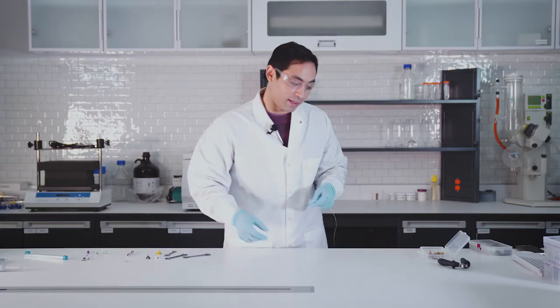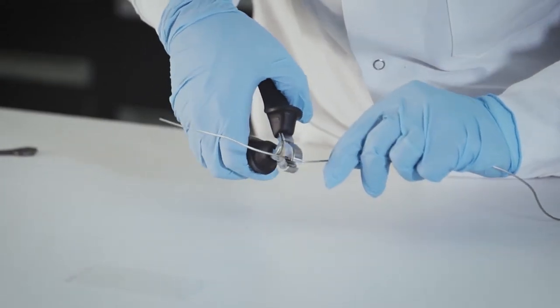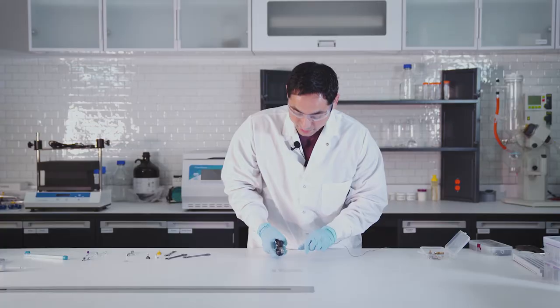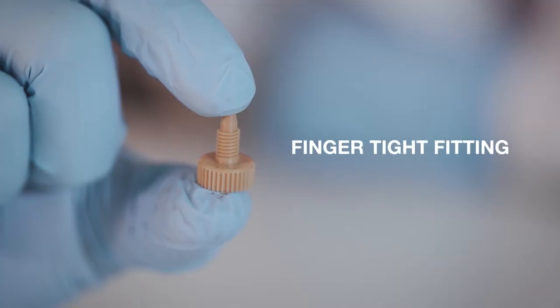Instead of trying to straighten it by hand, you can get one of these straightening tools. It allows you to clamp down on the tubing and you can straighten things out a little bit more. It's not gonna be perfect but much better than doing it by hand. But still super annoying.